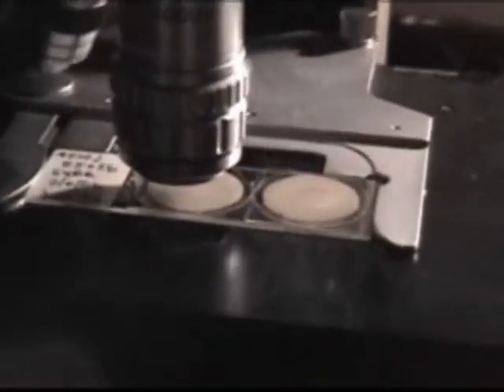Just like the other slides that we do, you mount them on the microscope, and then you use a little bit of immersion oil to actually view them through this 100x lens. And so when you look down the lens, you see almost instantly a huge number of viruses and bacteria.